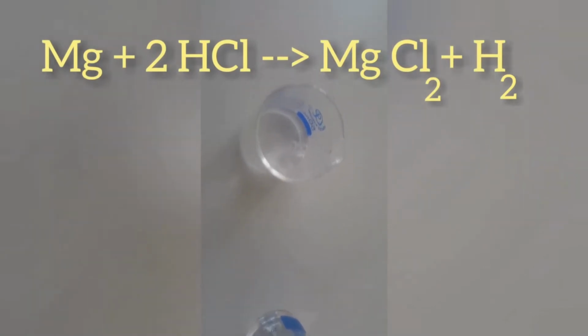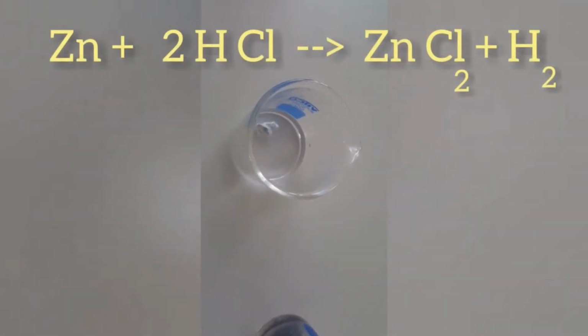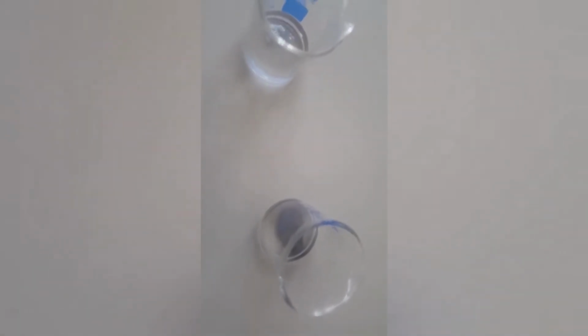Look at magnesium, it is reacting vigorously, and the product here is magnesium chloride and hydrogen gas. When you compare magnesium reaction with the zinc, it is less vigorous. Zinc also obtains zinc chloride and hydrogen gas, but that is less vigorous than magnesium because zinc is less reactive than magnesium. That's why the reactivity is less compared with the magnesium. You can see some kind of smoke. That is hydrogen gas is formed, but you can say the reaction is having medium reactivity.